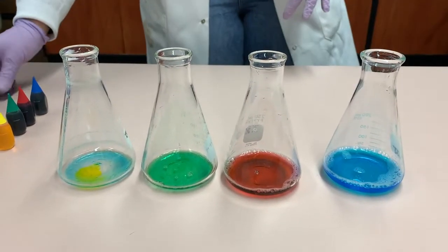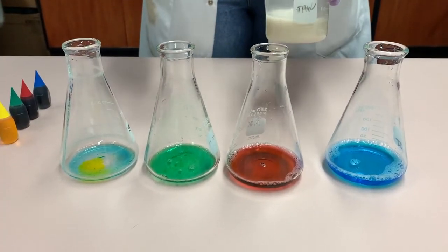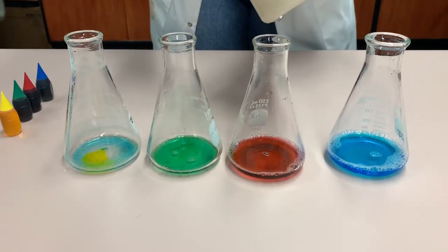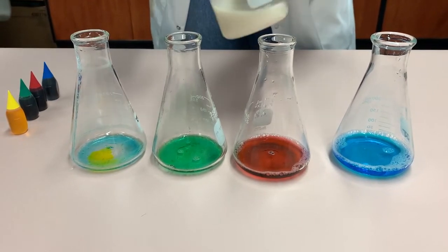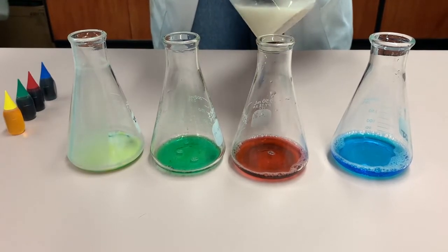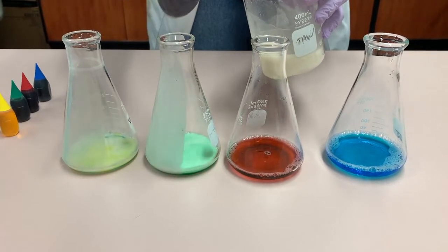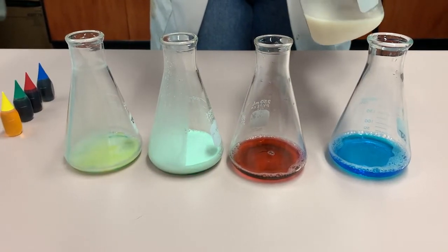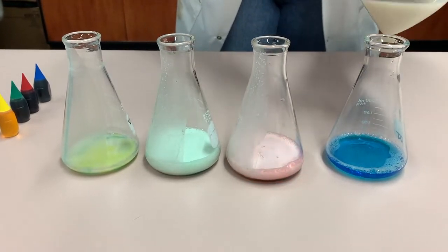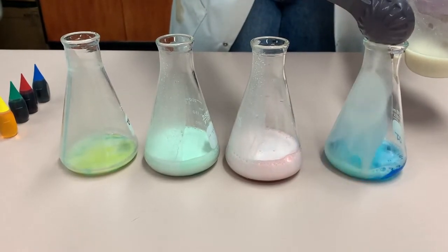Next, we add our yeast solution to each of the four flasks and watch what happens. One tablespoon to flask one, one tablespoon to flask two, one tablespoon to flask three, and finally one tablespoon to flask four.